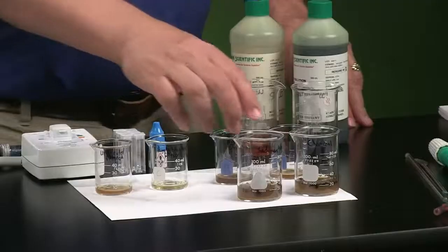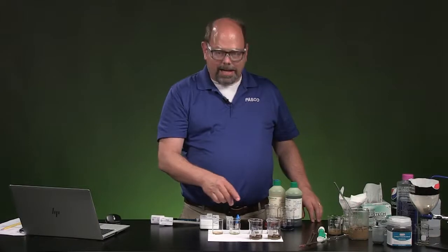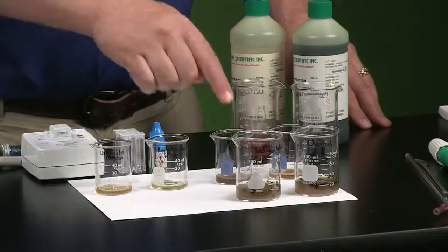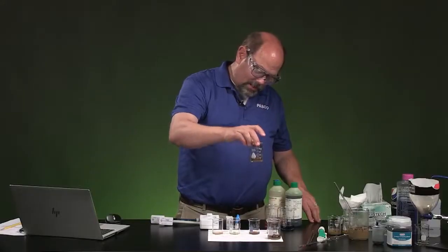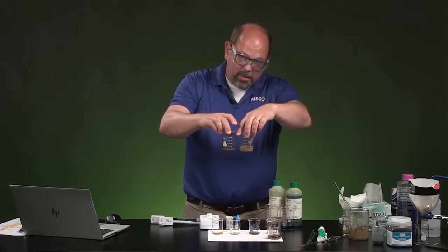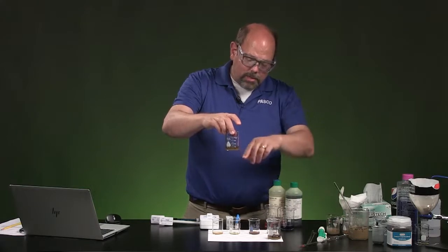Next, I put this milky kind of solution in about an hour ago. In the lab, it just says for about half an hour. Let it sit there so that it slowly sank to the bottom. With time, you can see it's a little clearer than what we started with when I disturbed it, stirred it.